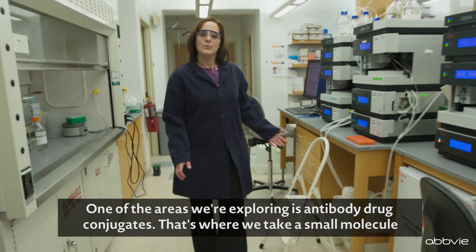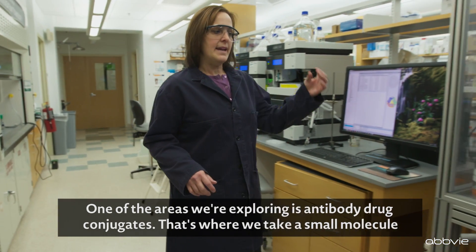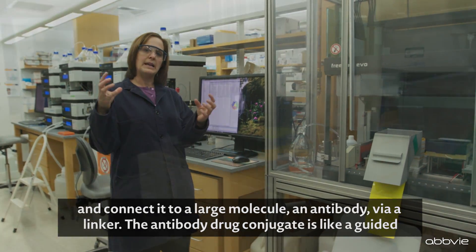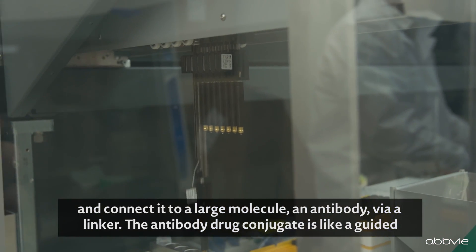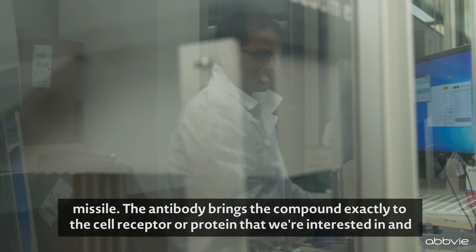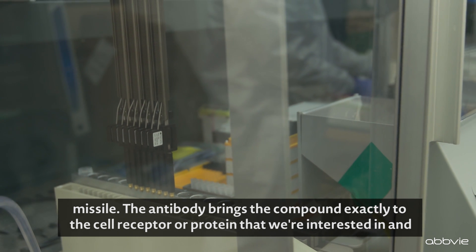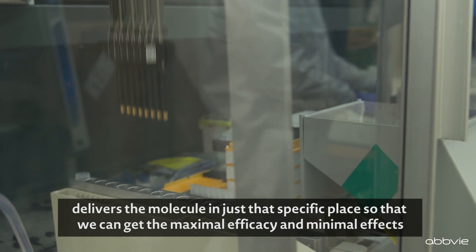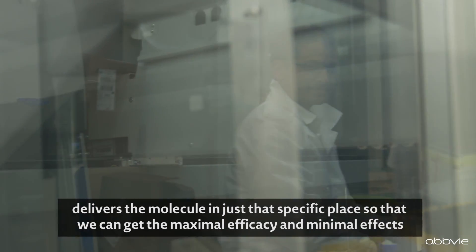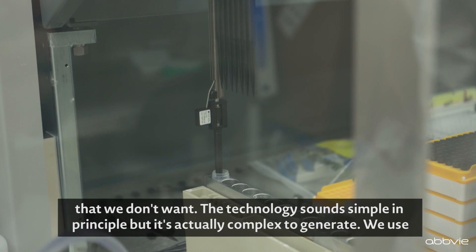One of the areas we're exploring is antibody drug conjugates. That's where we take a small molecule and connect it to a large molecule, an antibody, via a linker. The antibody drug conjugate is like a guided missile — the antibody brings the compound exactly to the cell receptor or protein that we're interested in and delivers the molecule in just that specific place so that we can get the maximal efficacy and minimal effects that we don't want.